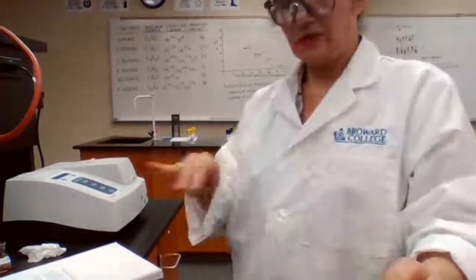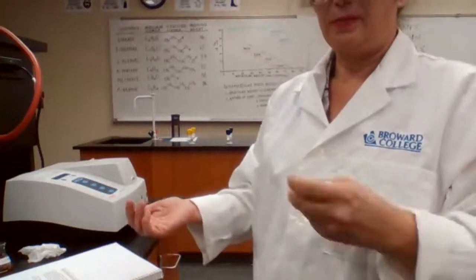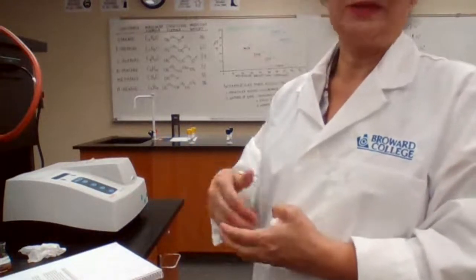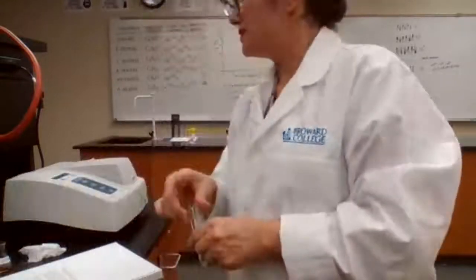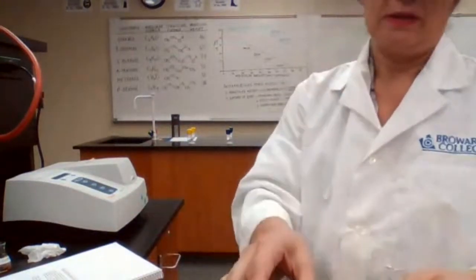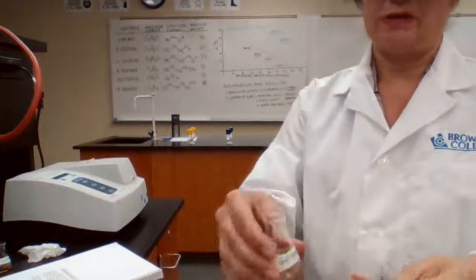So all the solutions that are measuring for standard curve, if we are performing the experiment today, we cannot use this standard curve tomorrow for a new set of the unknown. So everything has to be at the same time range. So during the same lab setting, same day, the machine needs to be calibrated, standard curve needs to be plotted, and then you measure the absorption for unknown using the curve to find the concentration.